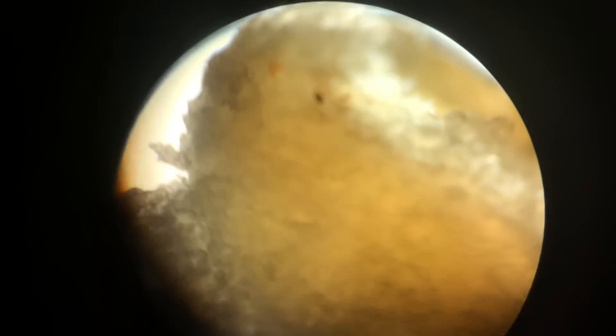This is not easy. There's one — it's blurry, probably because I'm holding it so close. The blind leading the blind here. I'm no expert in this with microscopes and the nanofibers and all of this. Okay, there's a good shot — now can somebody else please move the slide for me?